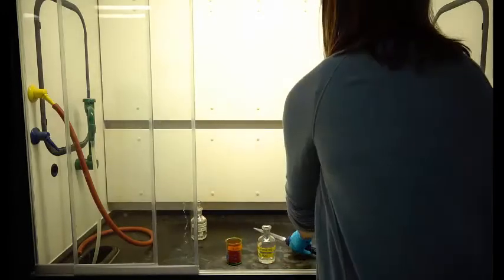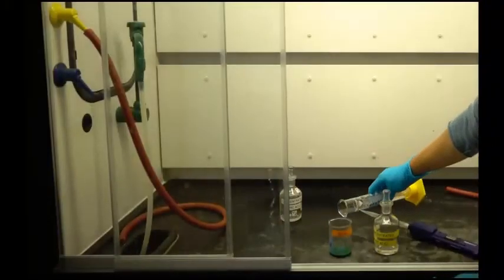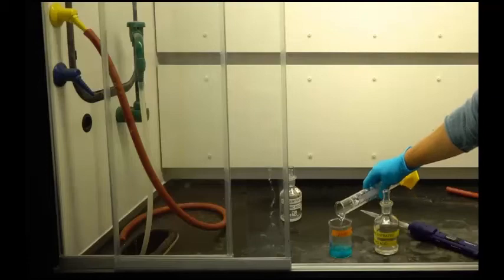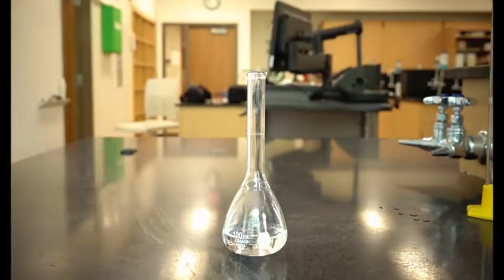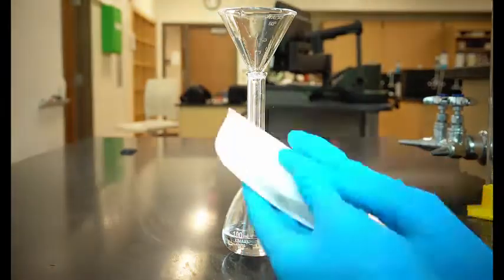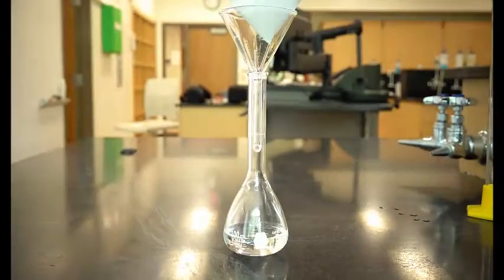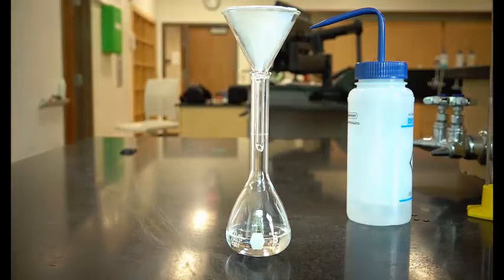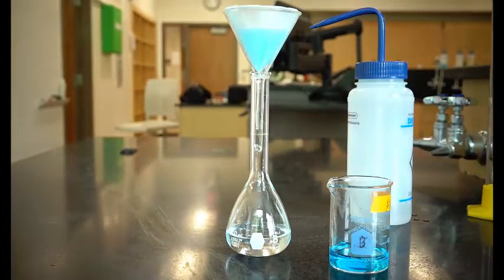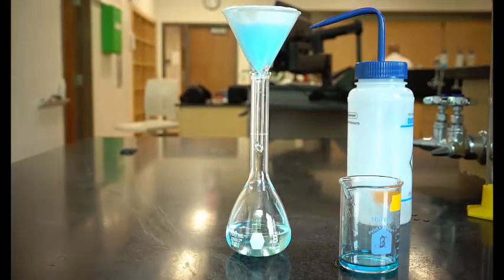After the reaction is over, add 30 milliliters of water to the beaker. Obtain a 100 milliliter volumetric flask and add about 30 milliliters of water to it. Fold a piece of filter paper into fourths and place it in the funnel so that there are 3 layers on one side and 1 on the other. Use a little water to seal it into place. Now filter your sample through the funnel. You may need to add it in stages if it does not all fit at once.